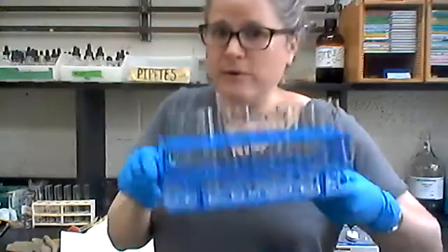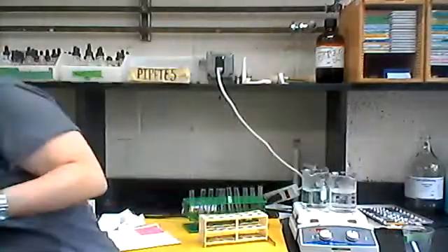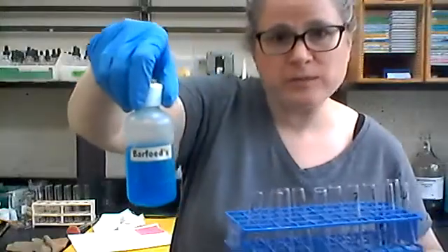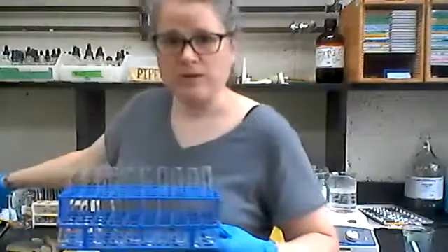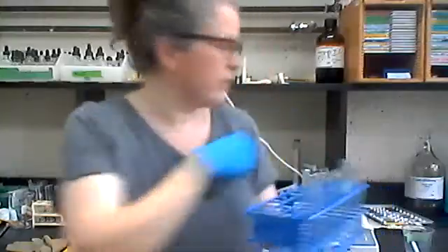Next, I will take these same carbohydrates and add two milliliters of Barfoed's reagent. That looks a lot like the Benedict's reagent, but it reacts differently, and this is testing for monosaccharides. So again, I'll fill all these up with two milliliters of Barfoed's reagent, put them in the boiling water bath again and come back and show you those results.